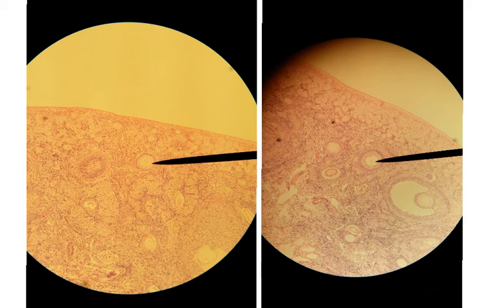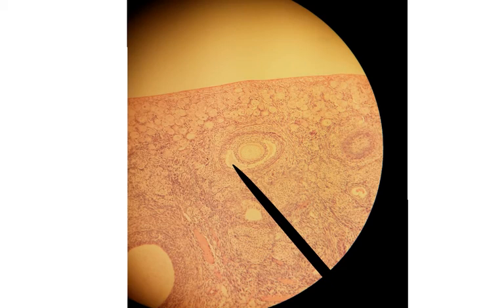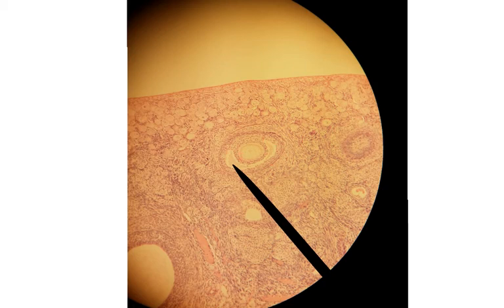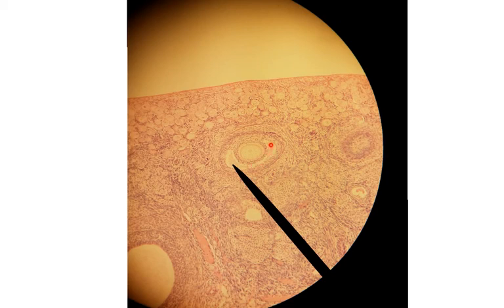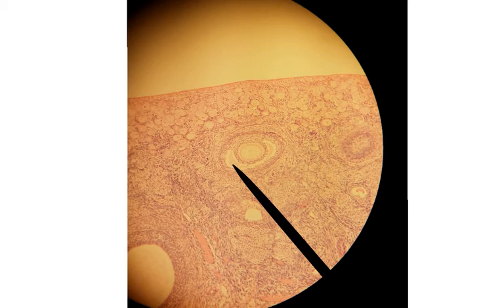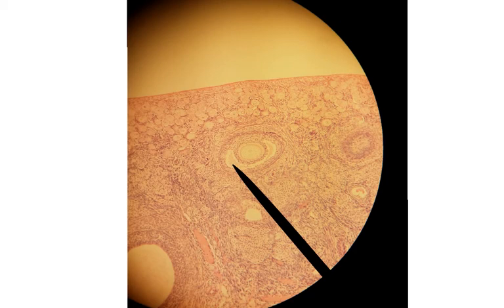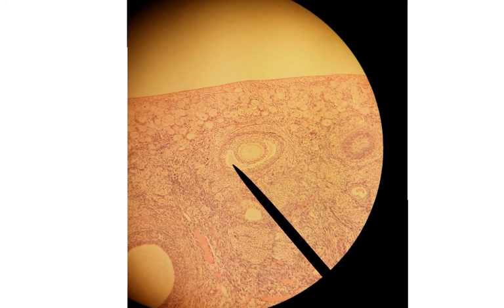Let's look at what happens when this primary follicle becomes a secondary follicle. In a secondary follicle, we still have the oocyte surrounded by cuboidal epithelium, but within the cuboidal epithelium we start to have a cavity forming. That cavity is going to mature into something we call an antrum later in the Graafian follicle, but in the secondary follicle it's just beginning to form.